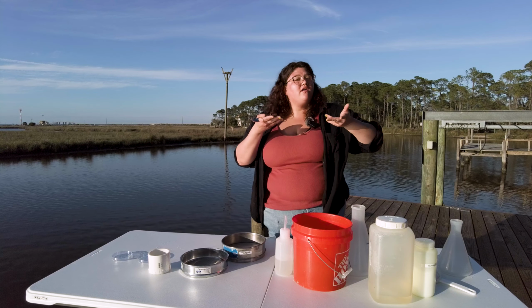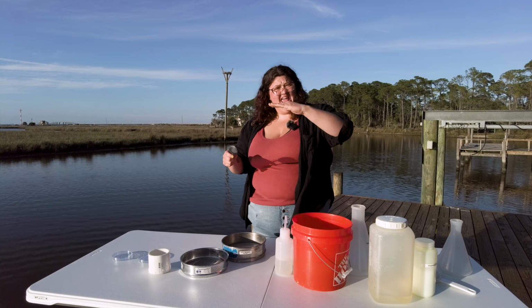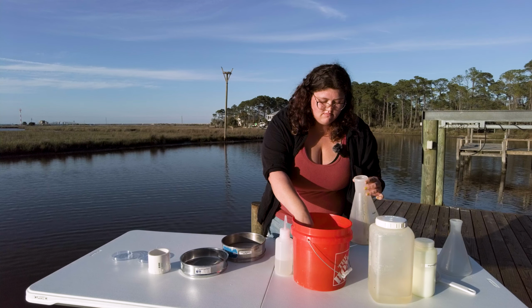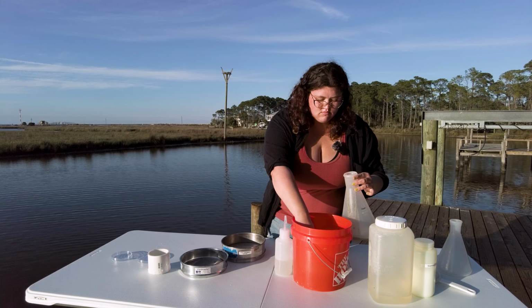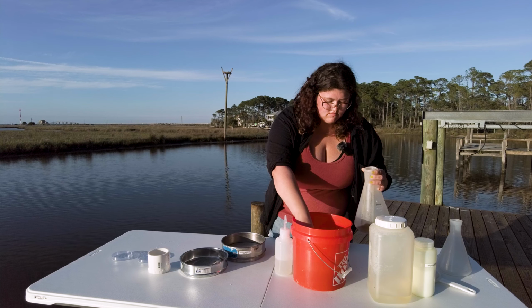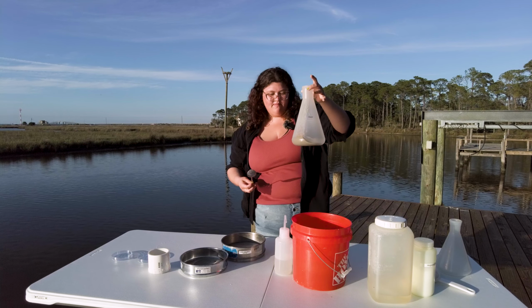The animals wanna come up to where the water is and tend to hang out in the first 1 to 2 centimeters of sediment. So if my hand is the sediment, you will just scrape along the top, grab the first bit of the sand, and put it straight into the flask. And so we have a good bit of sediment in there.